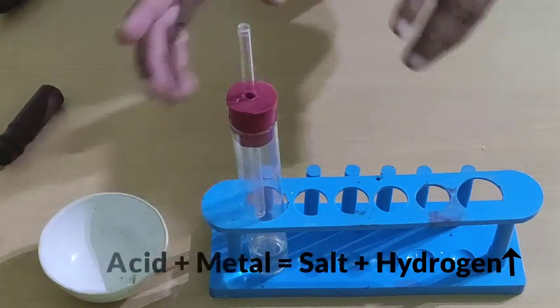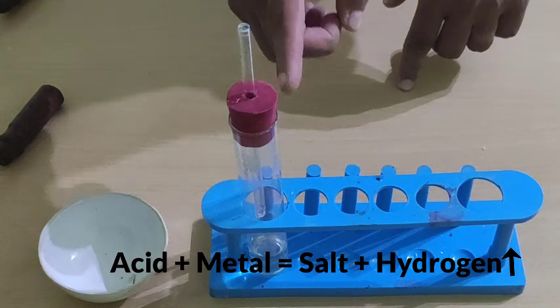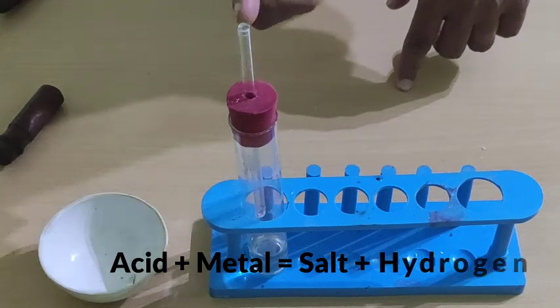Thus we understood that when a metal reacts with an acid, it creates a salt and hydrogen gas is released.